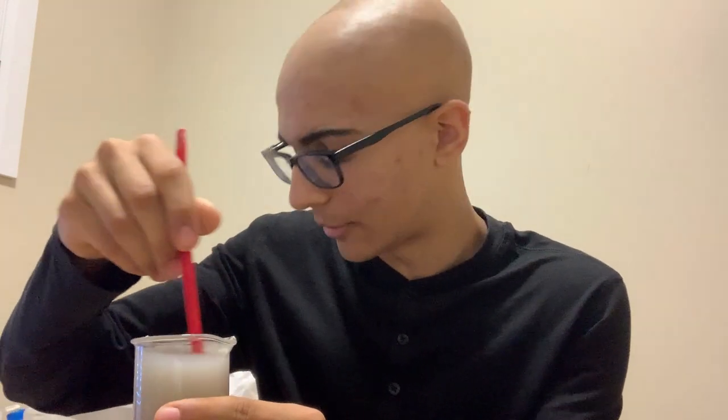So here I've got a beaker full of modified clay. I'm just going to stir it up as we're talking here. What it contains is 1 gram of modified clay inside 100 milliliters of water, along with 2 milliliters of my chitosan hydrochloride solution, which is in this little bottle here. So I'm going to now add 1 milliliter of that to this Pioreactor vial. I'm going to let it sit for about 12 hours.